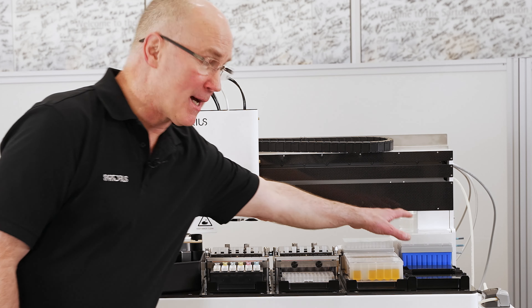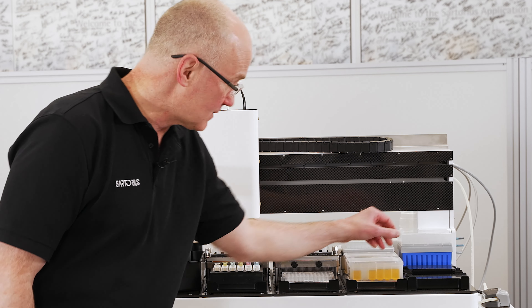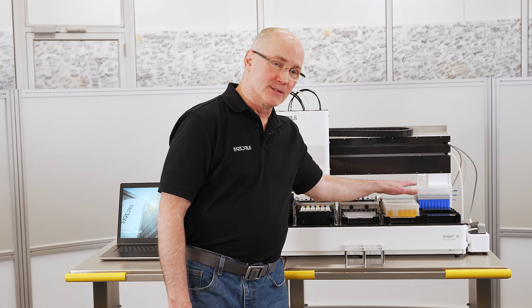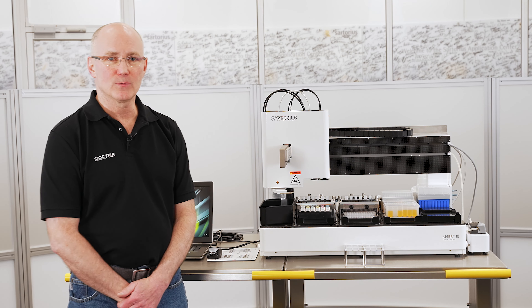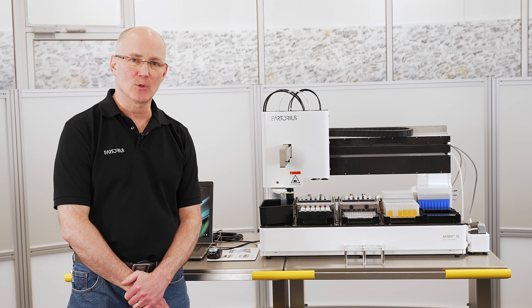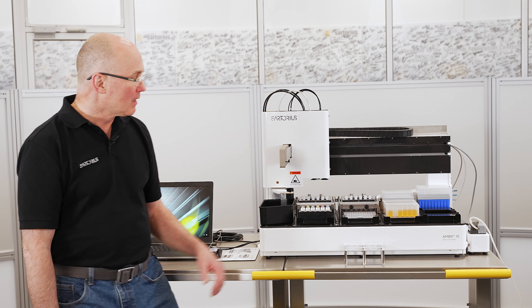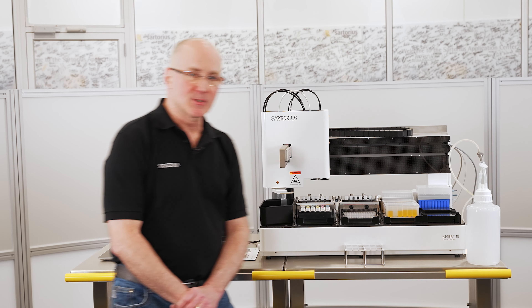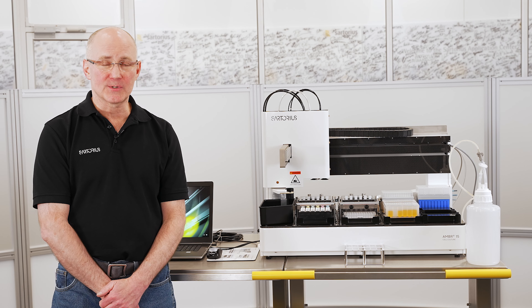The deck holds the 1 ml and 5 ml pipette boxes, and sample or reagent plates. The deck on the right side of the system is a universal deck that can be configured any way you like. One of the newer features is the rapid vessel drain, associated with the dedicated 1 ml pipette, which uses a peristaltic pump and a waste bottle to quickly remove a specified volume of liquid or cells. This is especially useful for microcarrier and perfusion mimic applications, enabling clones to be selected and screened using representative processes and conditions.